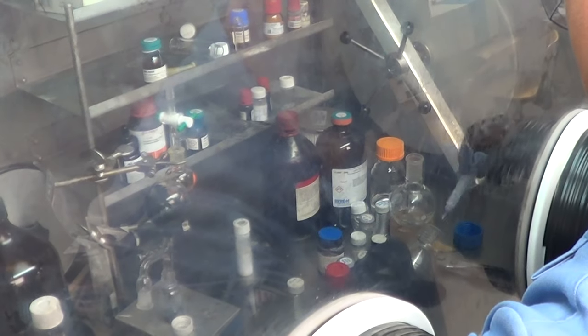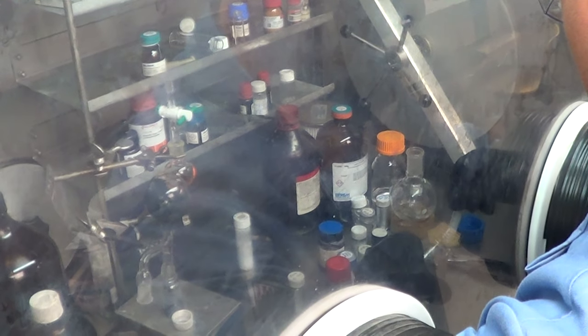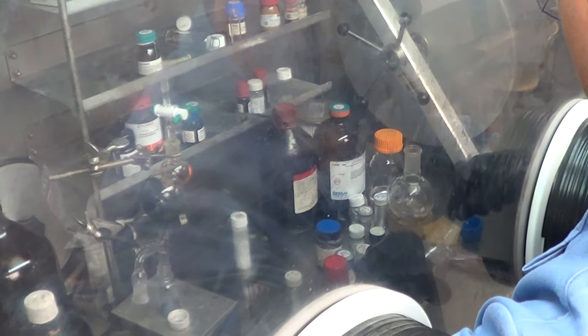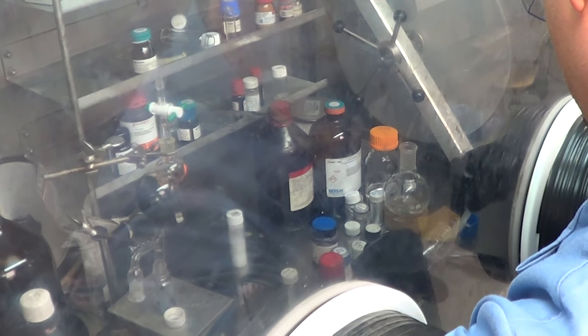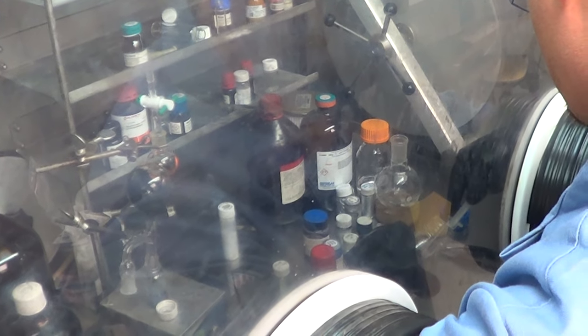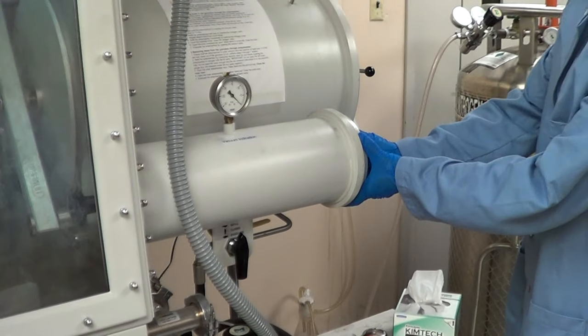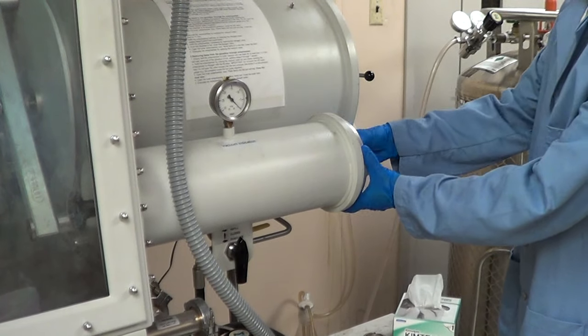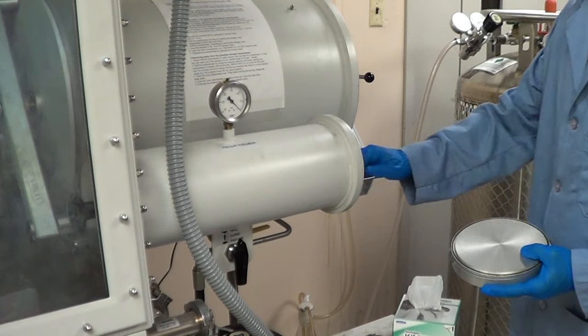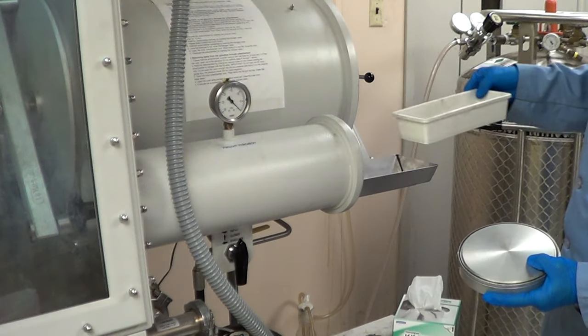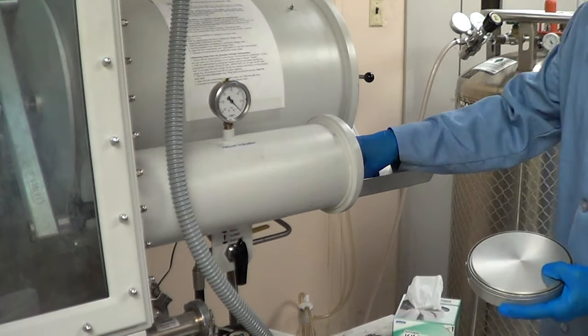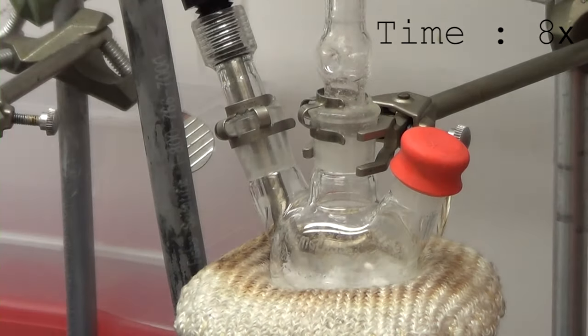There's even more things to point out here. As Marcel is getting the tri-octyl phosphine, TOP is actually very damaging to the gloves, so you can't let a single drop touch the gloves—it'll burn a hole through it. TOP is also extremely viscous, so it's difficult to handle unless you have a fair amount of experience with the glove box, which Marcel does and has good hand strength. Now we're taking the TOP out and we're going to add that to the 50 mL round bottom flask through the septum using a 21 gauge needle.